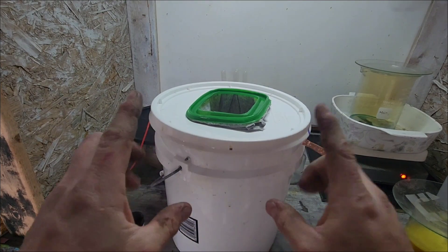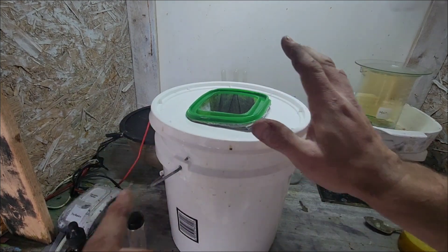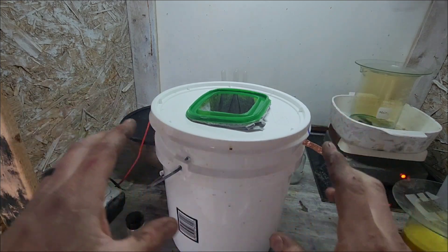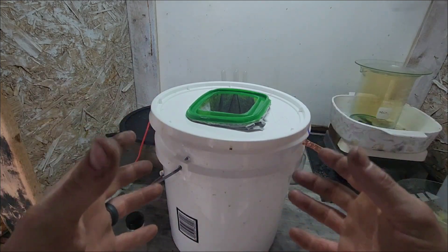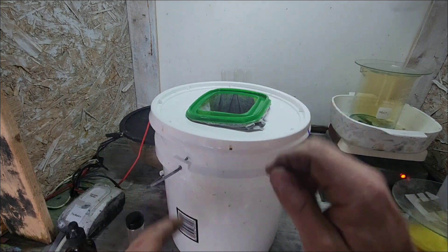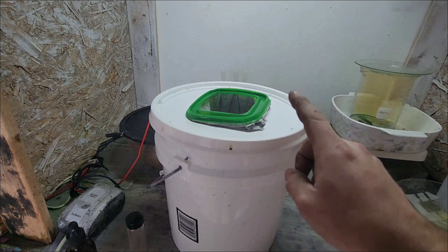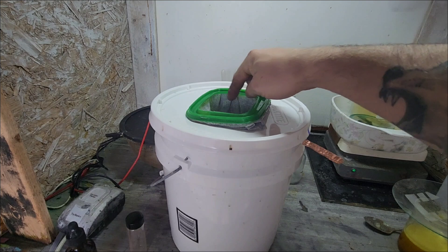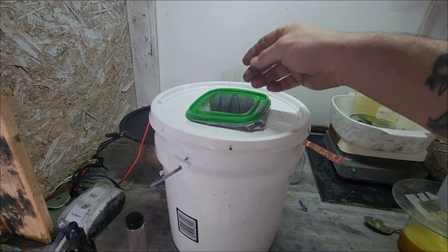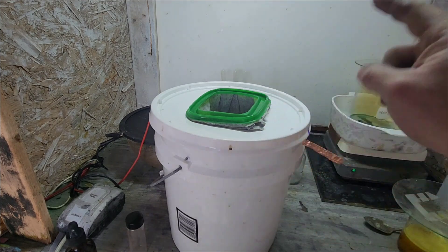Here is the latest installment of the copper cell. We've got a similar design to the first one I had, which was the stainless steel bowl. The thing I didn't like about that was it was really hard to get the copper off of the stainless, and I didn't like how it crystallized on top of my anode and basically made conductivity very hard to get through.